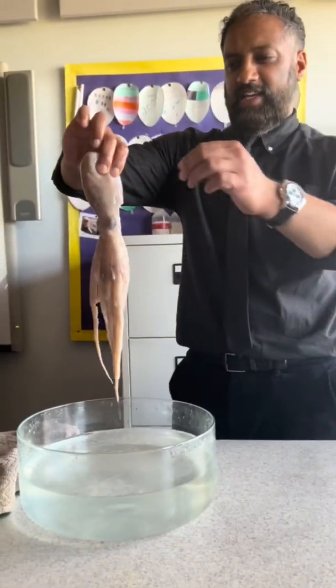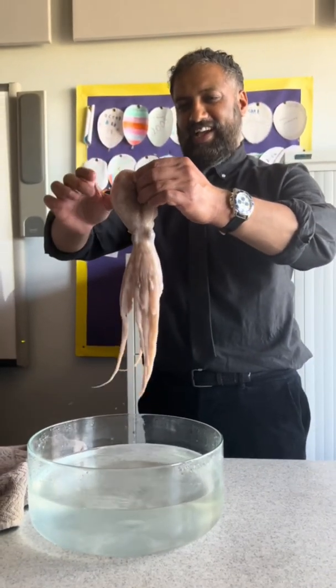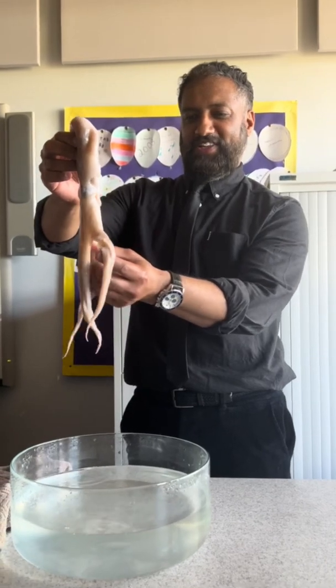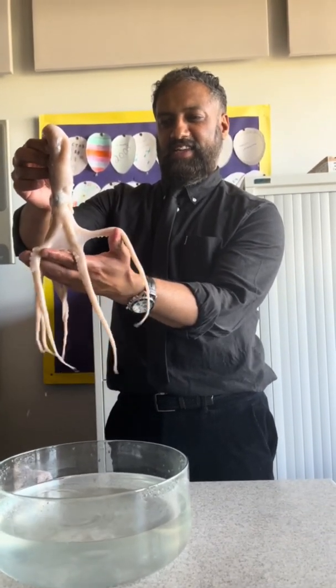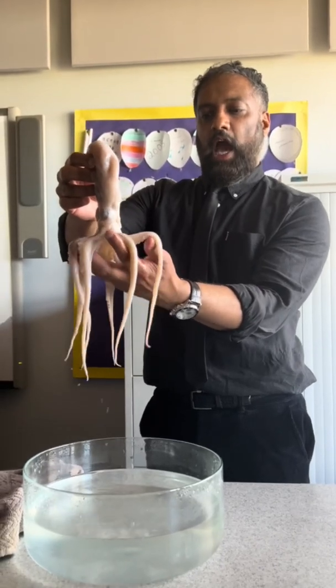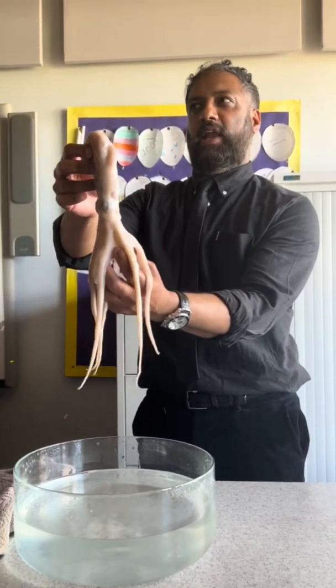So that is what it looks like. It stinks. It's dead already though. So what you do is, you can see the tentacles there. But as soon as it's dead, it's already dead. And you can see the ink. You can smell it.